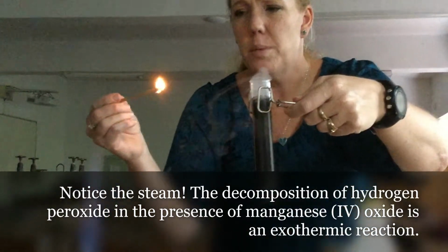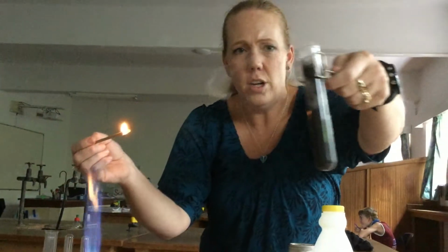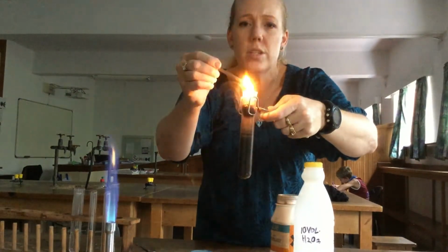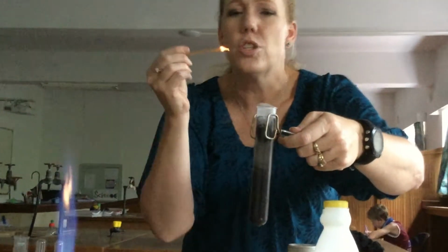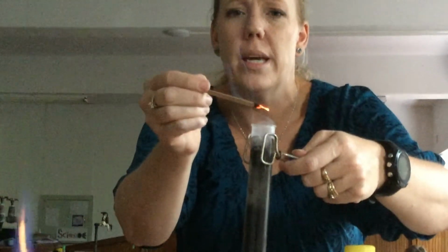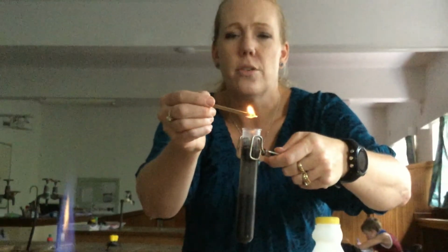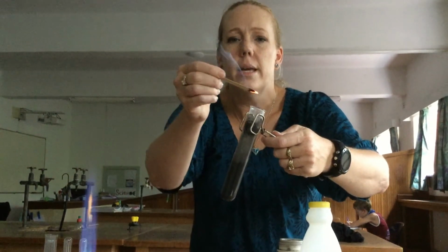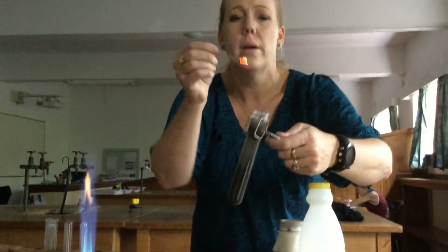We're going to get our glowing splint again. It's bubbling a lot. We get our glowing splint, we should see it relight as we bring it near oxygen. The test for oxygen is that it relights a glowing splint. And hopefully you can see it relighting over and over again as the hydrogen peroxide is converted to oxygen and water.